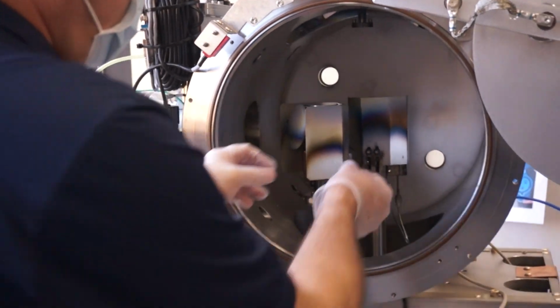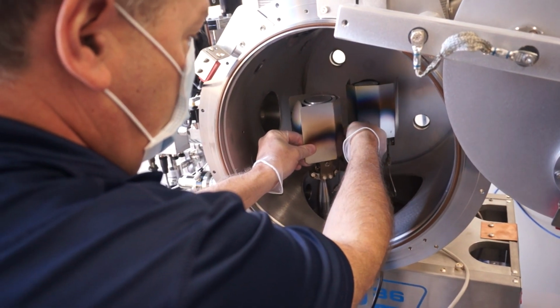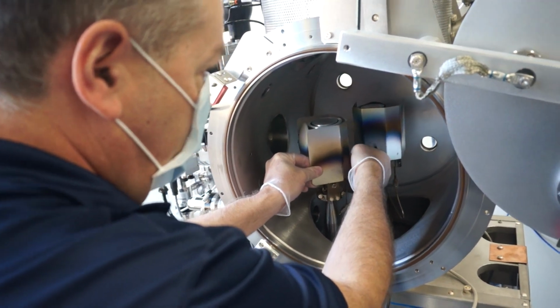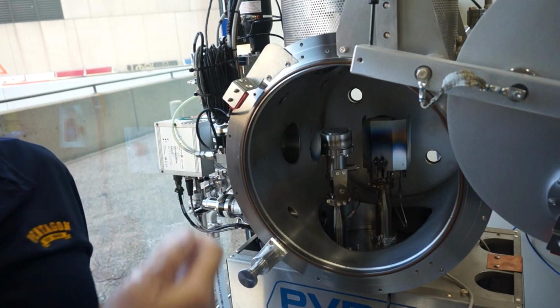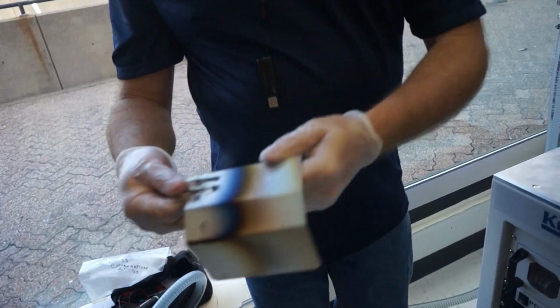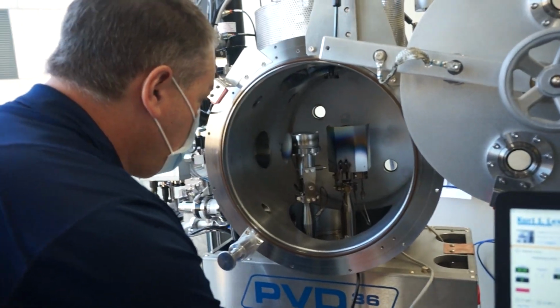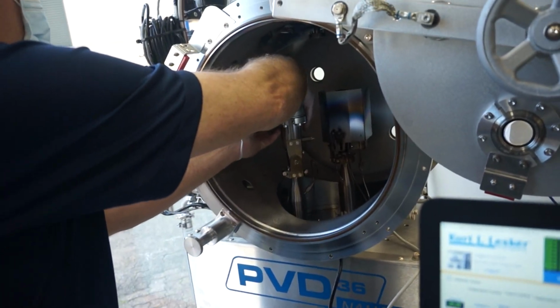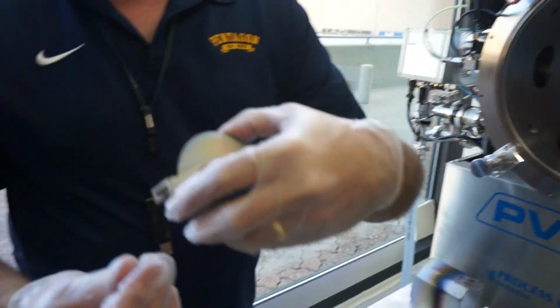I'm going to take a few things off, and I'll show you what they are. This component right here is a cross-contamination shield. You do this so that if you're running a second gun, you set it high enough that you don't get contaminants from the one gun onto the second target. It's basically some thumb nuts, and you can adjust the height through the slots. This compact dome shutter works in the same manner. There's a pin, or the threaded portion, and you can adjust the height.